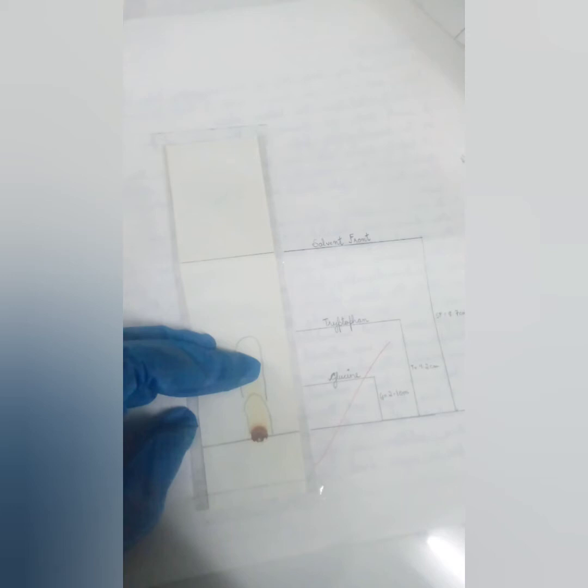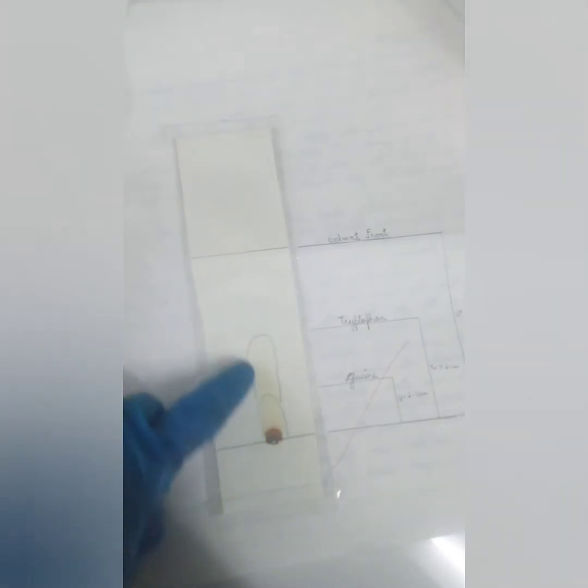you will take out this paper and dry it, and so that these amino acids will be visible, we will add ninhydrin. Again, the first reaction using ninhydrin, to detect amino acids. So here also, since these are amino acid samples, we will use ninhydrin. We will spray ninhydrin on this paper. Then these different colored spots are visible here.